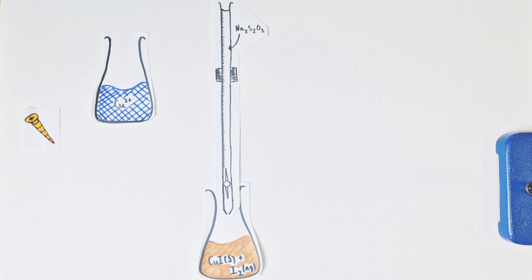At this point, we take a standard solution of sodium thiosulfate. This standard solution would have a known concentration, which will be the point. We can then compare the known moles of our reactant against what it's reacting with, which in this case will be the iodine in this vessel. So as the iodine gets exhausted, as we add the thiosulfate above, the color of this brown suspension will start to fade and become lighter and lighter yellow as we proceed.